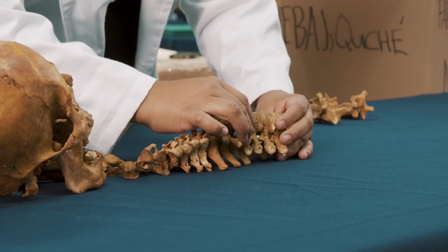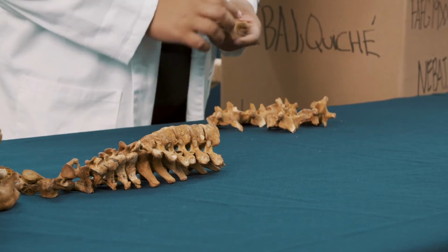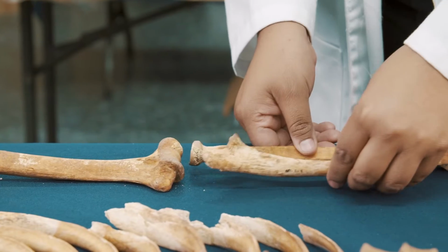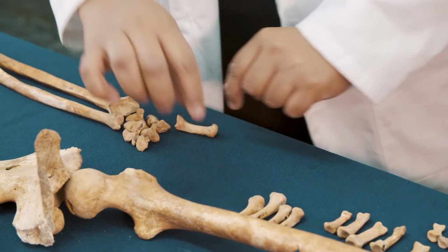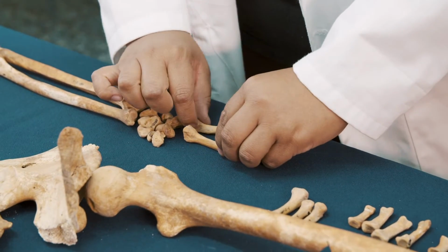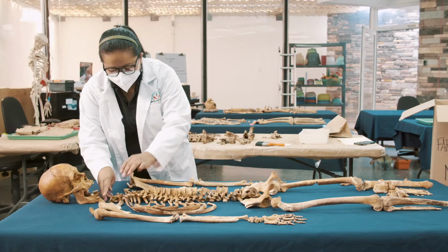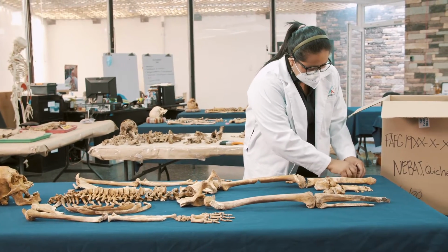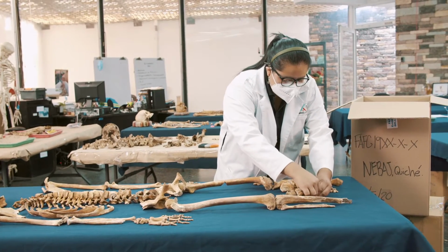The analyst will use different anthropological methods to establish sex, age range, age group, or bone development stage, and individualizing features, such as antemortem fractures, defects, pathologies, and stature. Determining the biological profile is also important in the identification of the person, as it forms the basis for the comparison of antemortem and postmortem results from the forensic investigation.